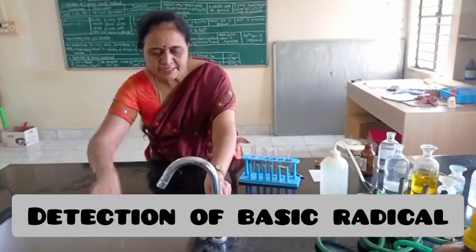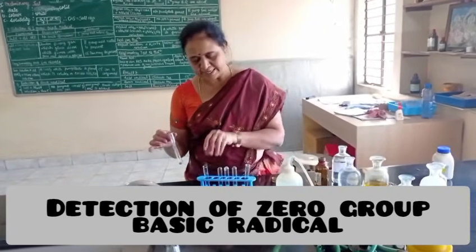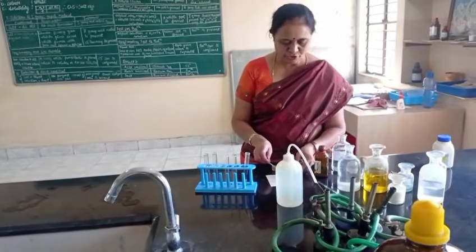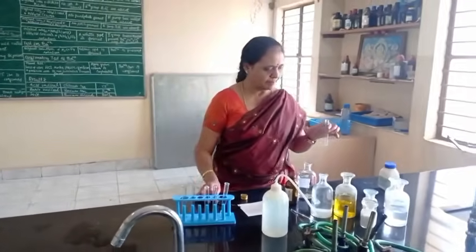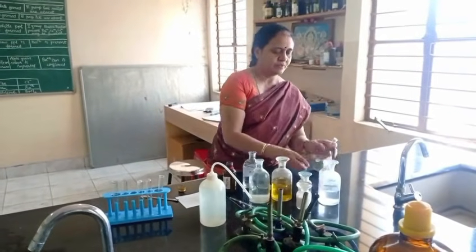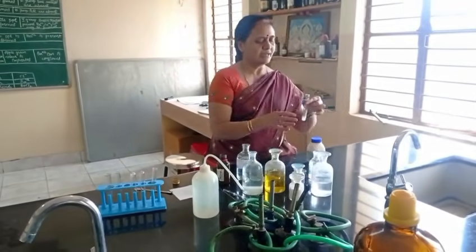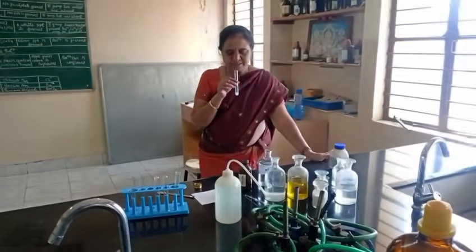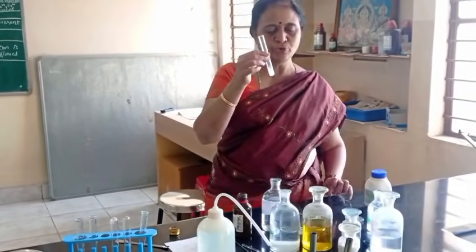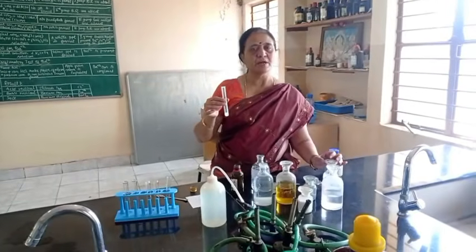Now, we are going to detection of basic radical. Detection of zero group basic radical. For zero group basic radical, I take salt plus dilute NaOH. See here, I am smelling the gas. No pungent smell of ammonia gas is observed. So, zero group basic radical is absent.